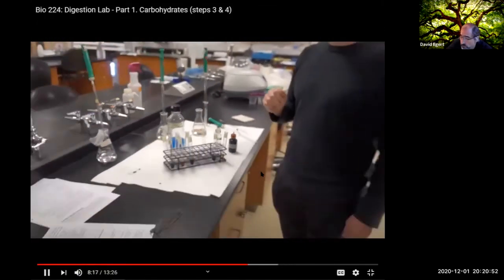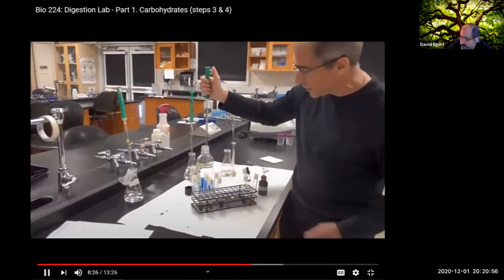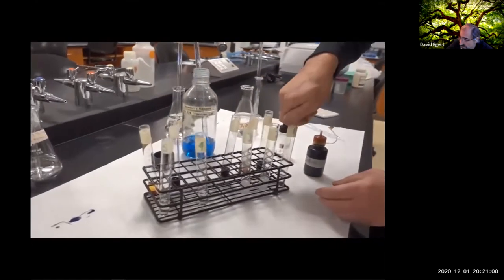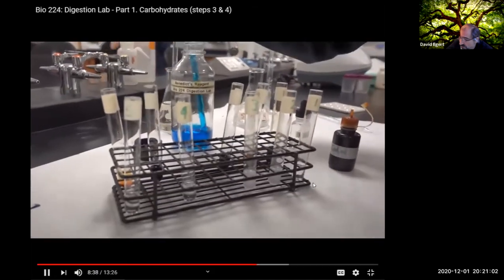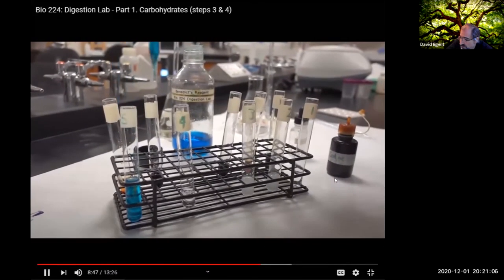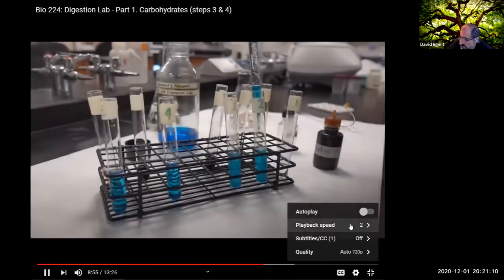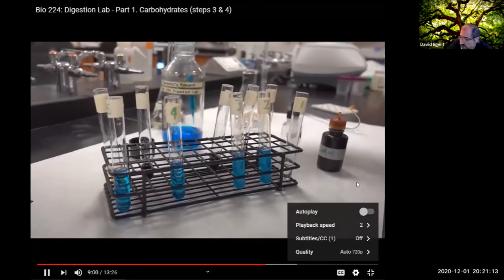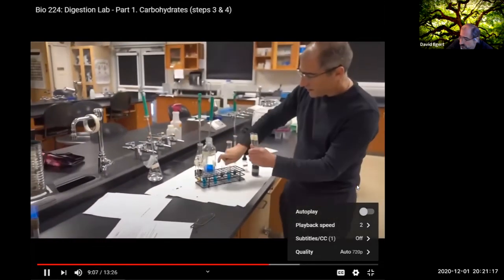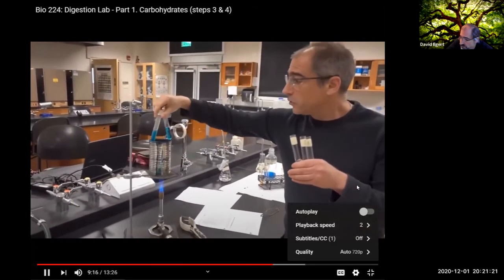To do the maltose test, we have to add in 4 mL of Benedict solution into each of our other tubes. So now, again for each tube, let's heat this up. There's 4 in there, 4 in there, and finally 4. 3, 2, 1. All right, so now each of these is going to have to get boiled for 2 minutes. So let's put these in.